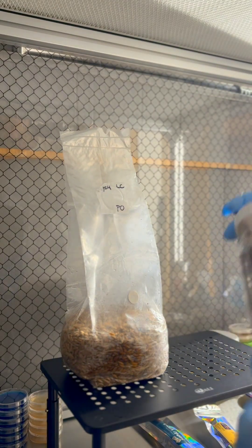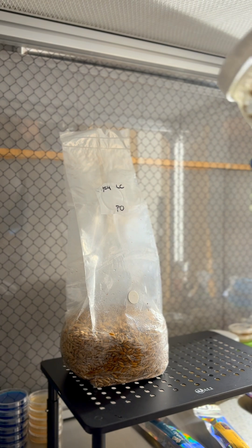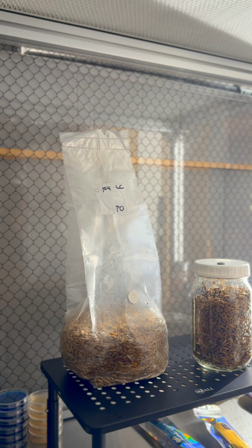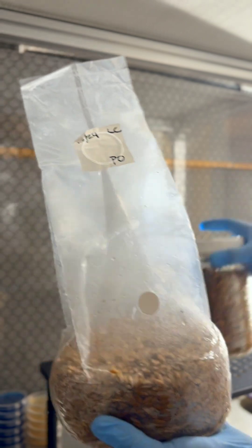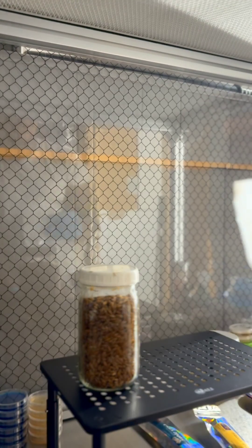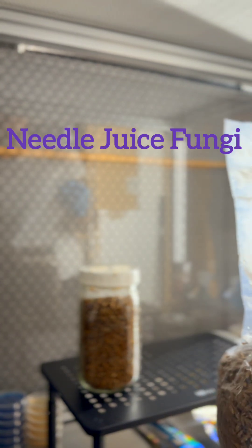That's it — you're gonna go put those in the incubation chamber. Same with your jar: label it, put the date on it, put the culture name. Those are inoculated. So that's how you inoculate bags and jars that have injection ports. Now I'm gonna show you how to inoculate bags that don't have injection ports. You can get this grain on our website, or if you want to make your own, check out our YouTube channel tutorial on how to prepare grain spawn.